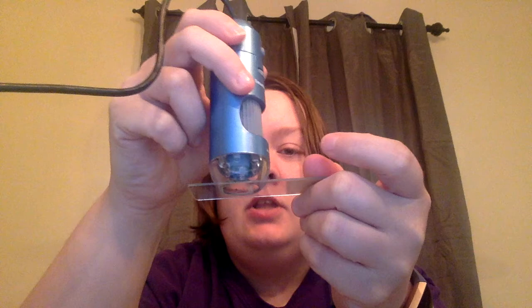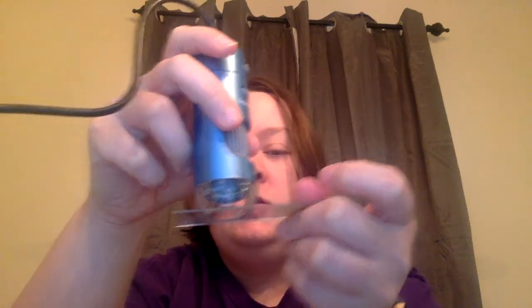And the way these work, I can either place it on a stand, and when it's on the stand, hold it up to a normal slide to view my specimen. But these are also really cool because I can hold them right up to my hand or my shirt or a coin, whatever, and view the microscopic image of that object, which is really awesome. And the way that we adjust is by using this little knob here. We can adjust both our magnification, so how zoomed in we are, as well as our resolution, which is how clear we are. So again, really cool little microscope.